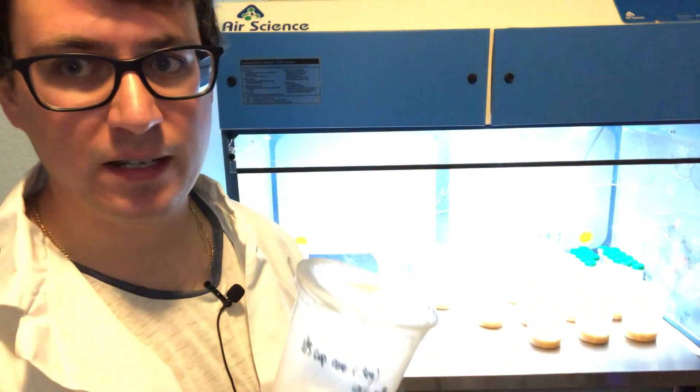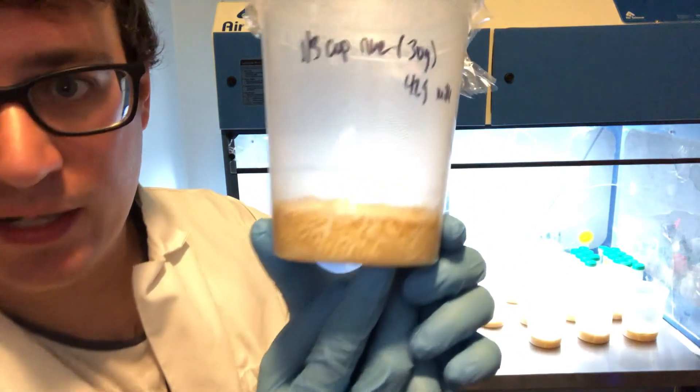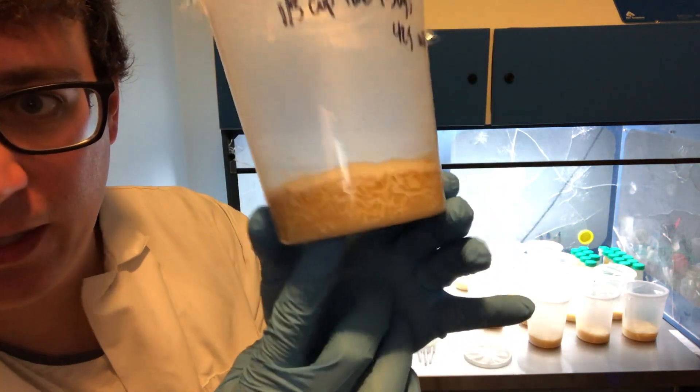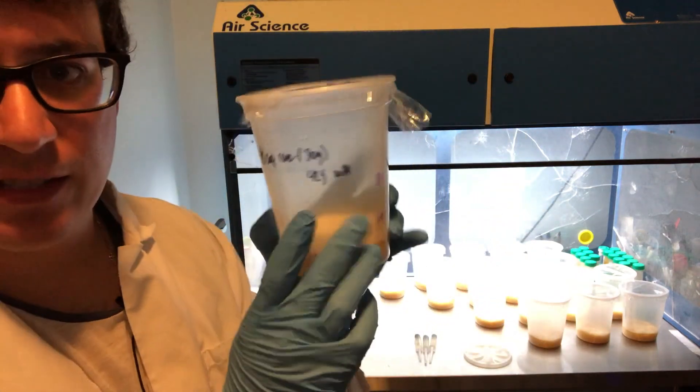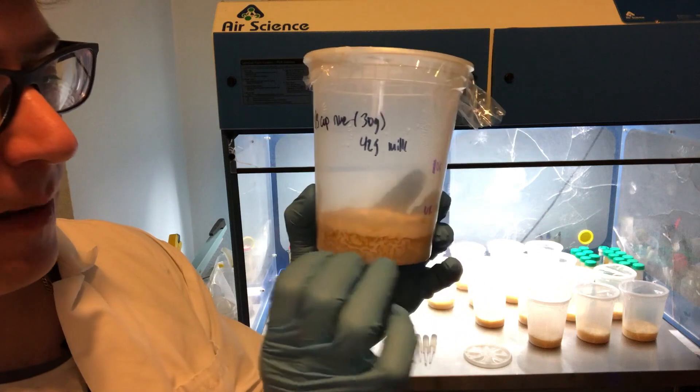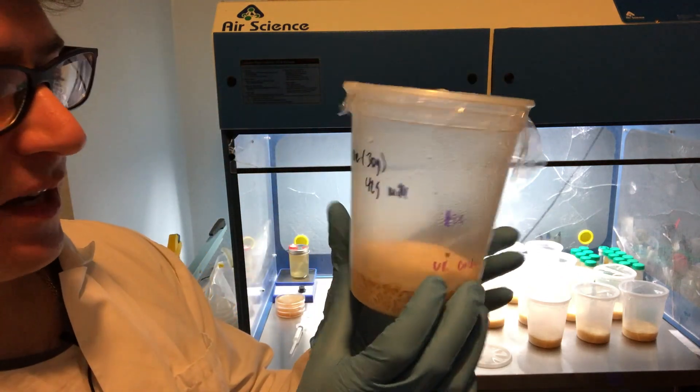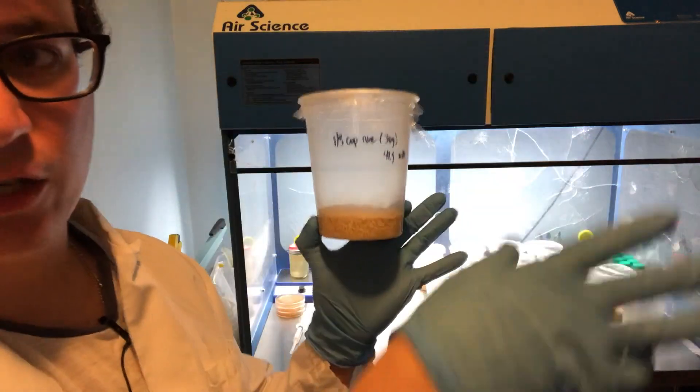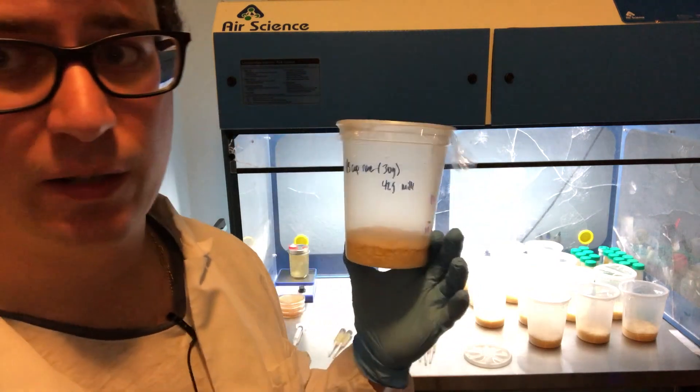It's about five days in and you can see it's got some really nice colonization. I selected this jar to replicate just because it has really healthy growth and compared to the other jars it colonized the first. I don't know if it's just because there is slightly more liquid culture, but I really like the thickness of this substrate.